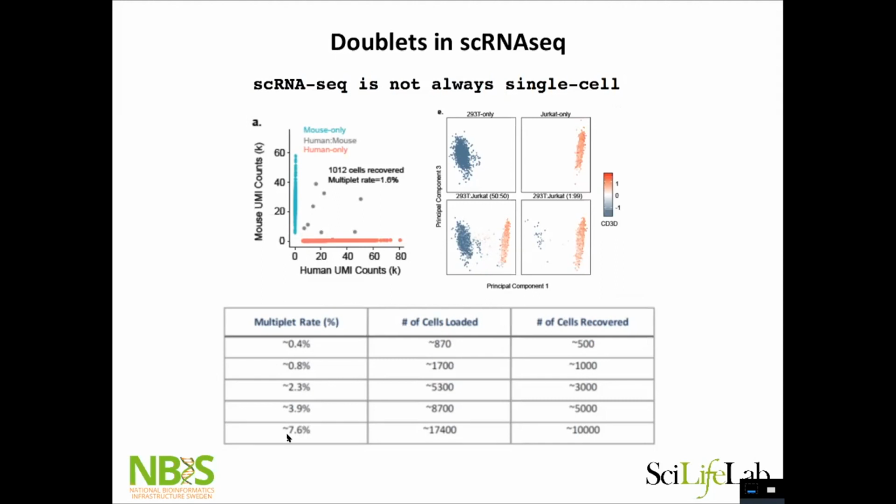And the estimates are that it's a linear increase with the number of cells you load and the number of doublets you get. So basically, if you load just 870 cells, less than 0.5% of your cells will be doublets. But if you're aiming really high, you will get around 8% doublets. And then it starts to become tricky how to analyze the data. So it's really something you need to think about: what you want to do with your data and how many doublets you can afford in the analysis step.